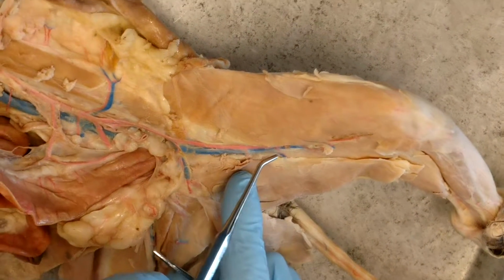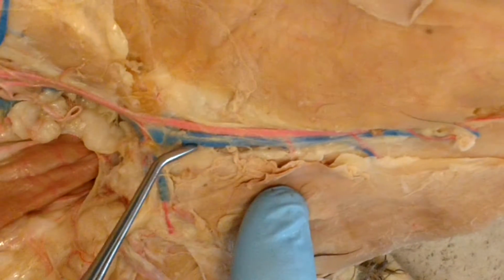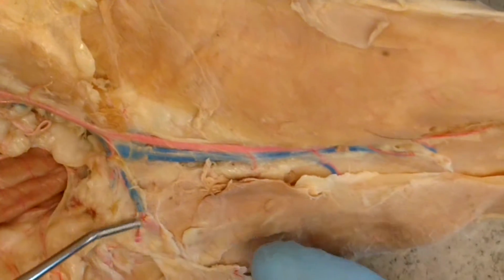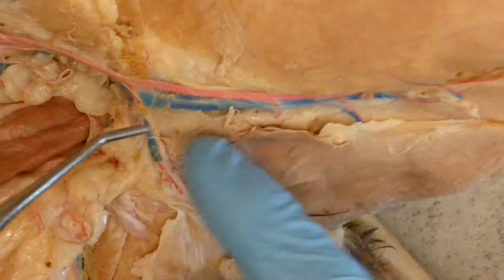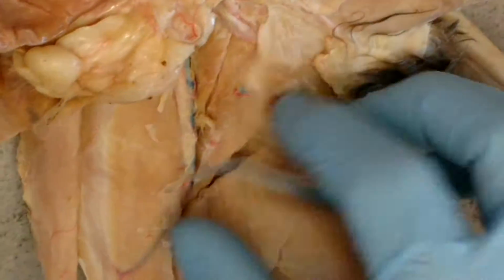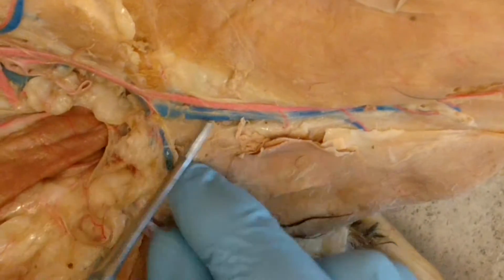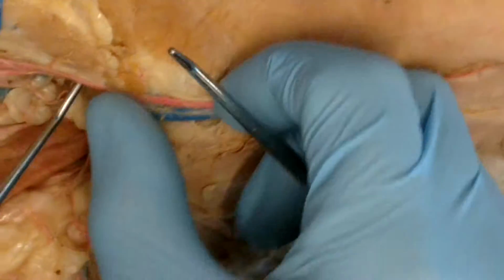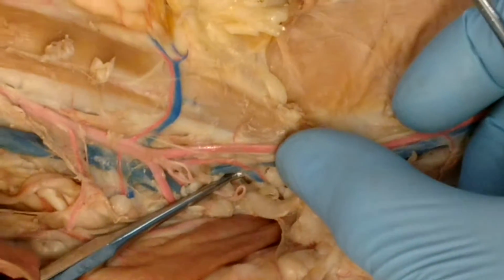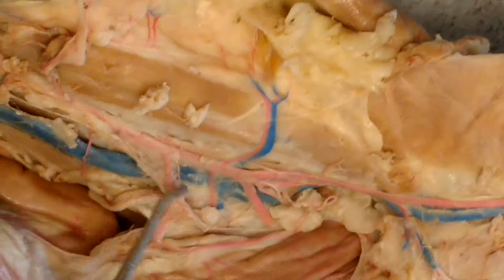Then, running along the artery, we have the femoral vein. This cat has had the great saphenous vein broken, which would be running along here, more superficial. And we didn't get any dye in this side, so we don't even have a great saphenous vein, but we would have this big blue vein that would come down here. So the femoral then becomes the external iliac vein. We have an internal iliac vein down there. Then we do have a common iliac vein in the cat. The common iliac veins merge to form the inferior vena cava.